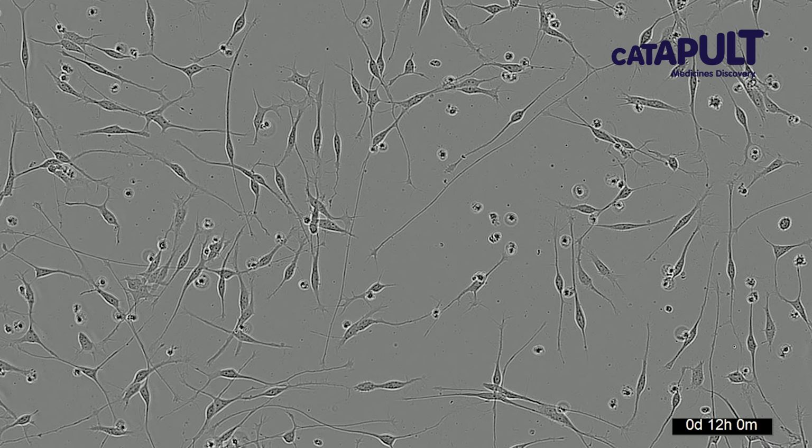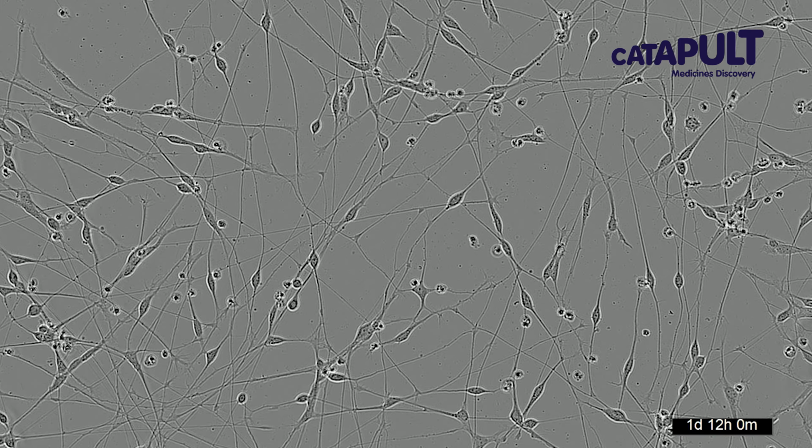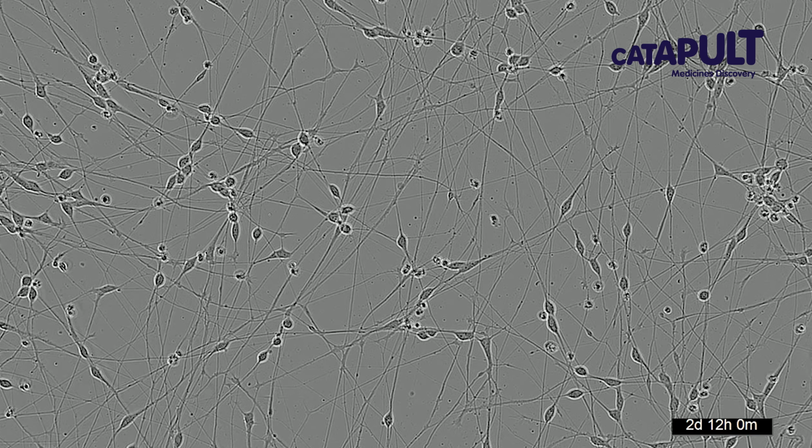For example, with neurons, we can look at how neurons grow, we can look at their activity and how this changes with disease states or in response to drugs. You can see in this video how human stem cell-derived neurons grow in culture over time. Here, control human neurons are shown, but we can also look at disease models.